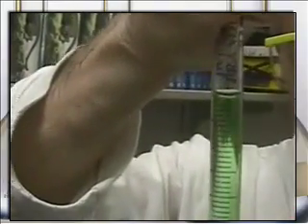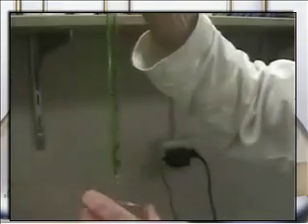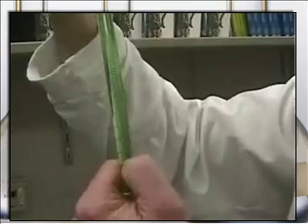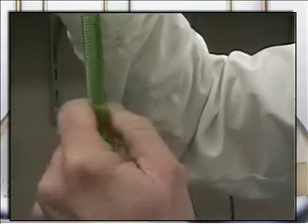Boom. Notice also that the bottom of the meniscus is on the 0. Do you see that? Now, I need 8.3 milliliters of this, right? So now what I'm going to do is put 8.3. Now this is a 10 milliliter pipette. If I needed 10, I could just let go and it'll all go through. However, I need to stop at 8. There's the 8, so it'll be 3 decimal places after that, 8.3.